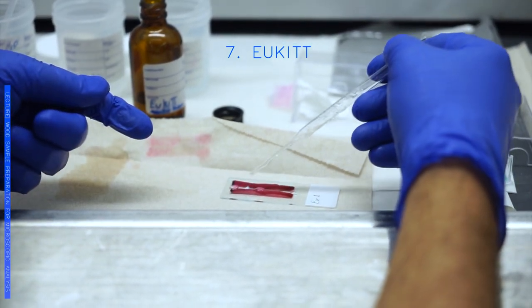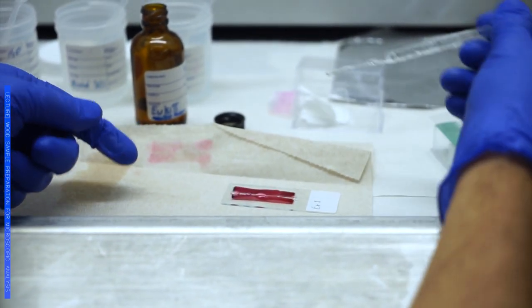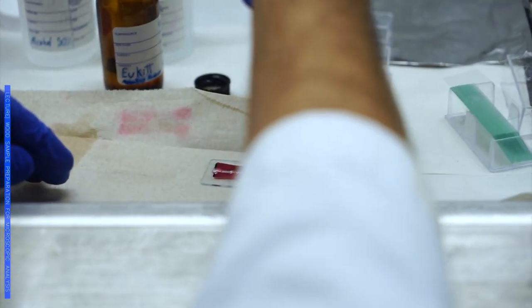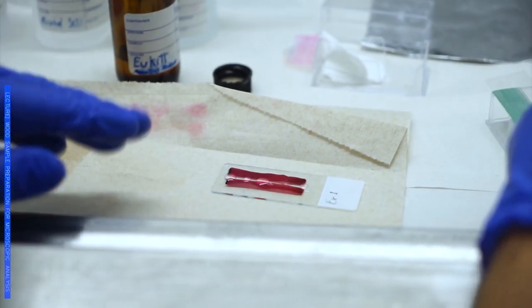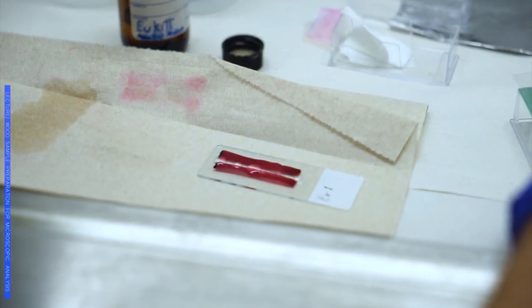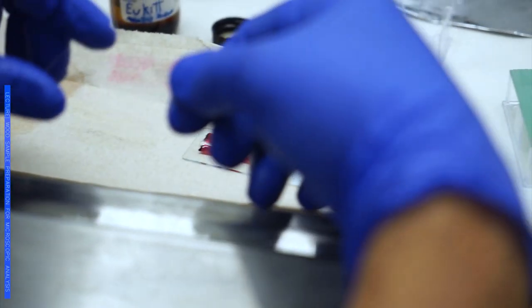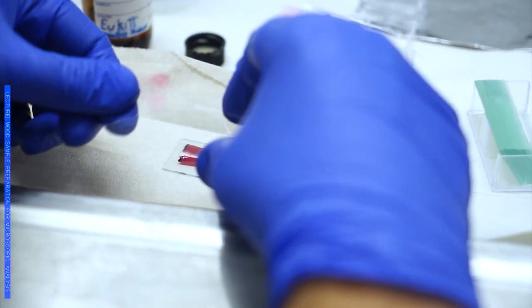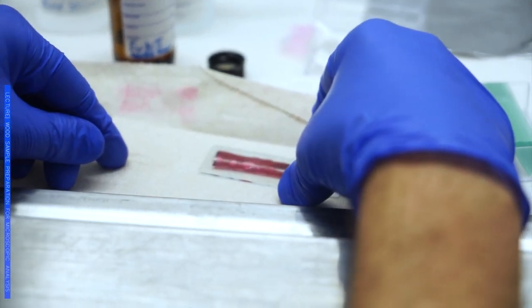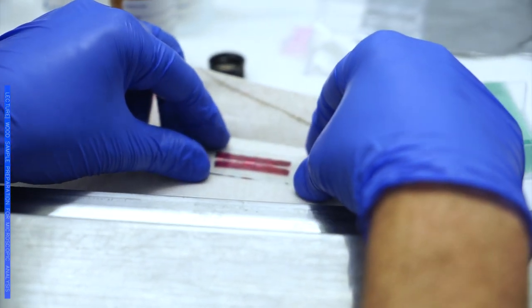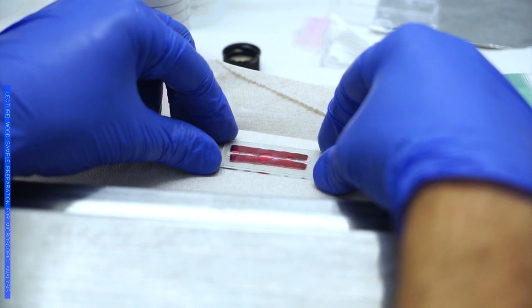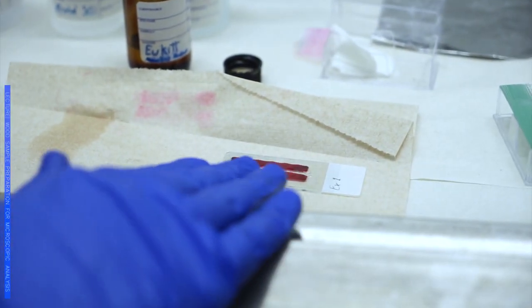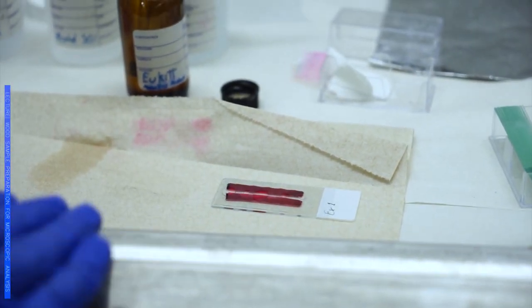You can see it dry a little bit, but the drops will maintain it in its position. Here we have already enough mounting material to cover our glass slide. At this point, we just need to bring it, cover it, and we will just leave it for a couple of minutes so the mounting material will spread all over the sample.